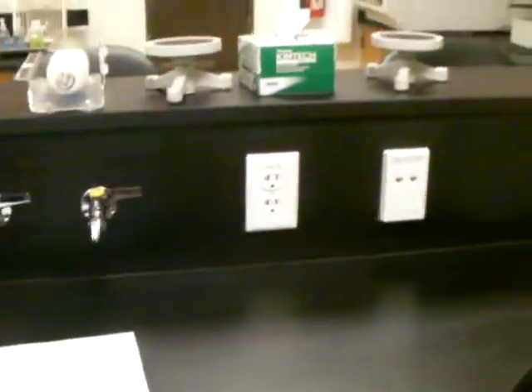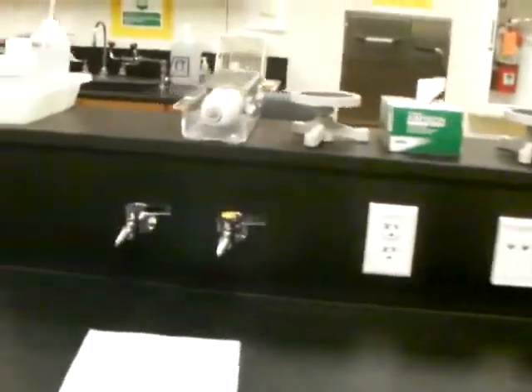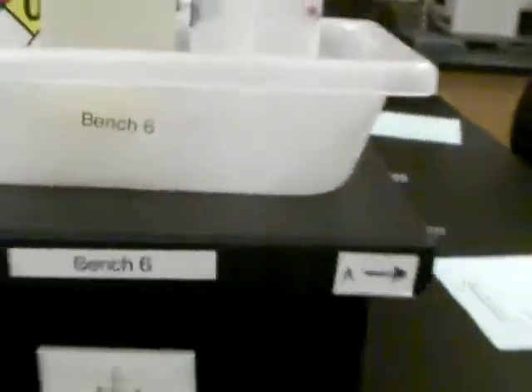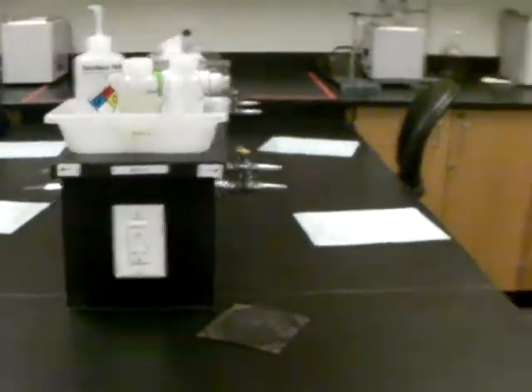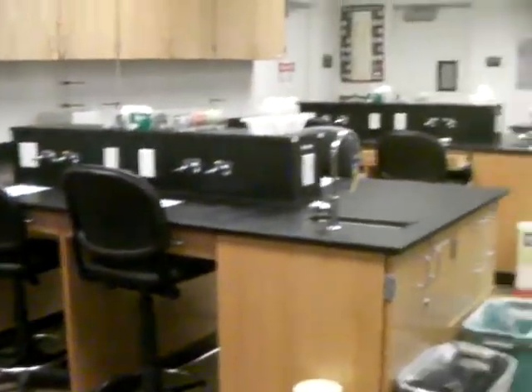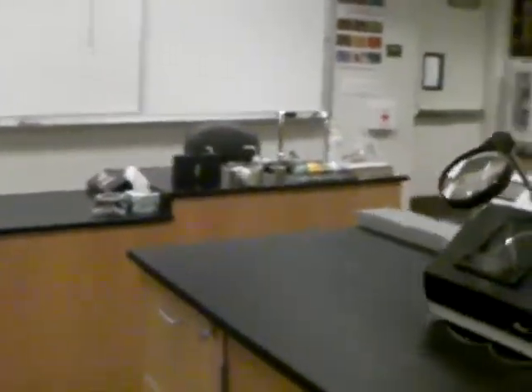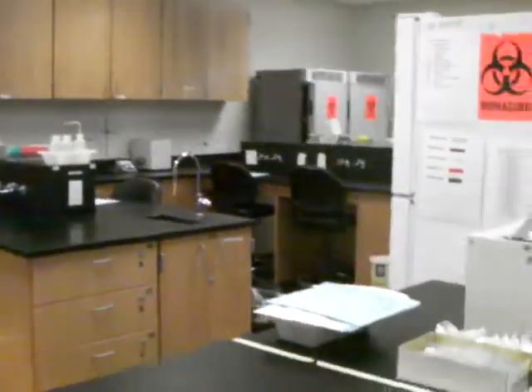This is going to be your bench — the place you'll be sitting. Each bench has a number. On the right side we have the even numbers: bench 6, bench 4, bench 2. On the other side — the left side looking from the front — it's going to be bench 1, bench 3, and bench 5.